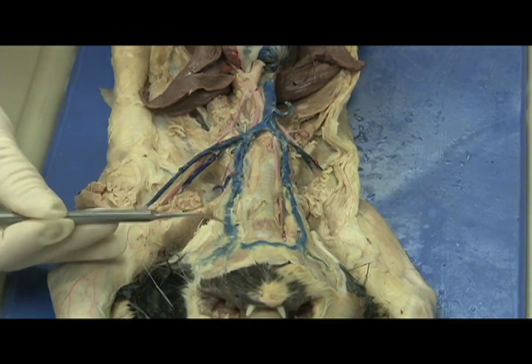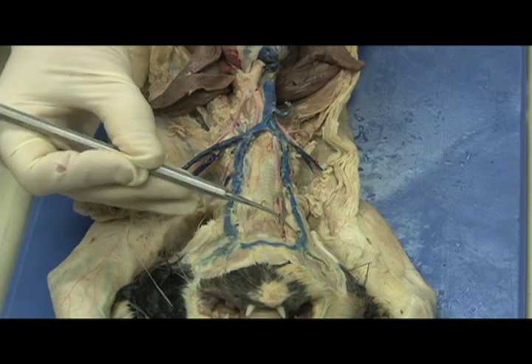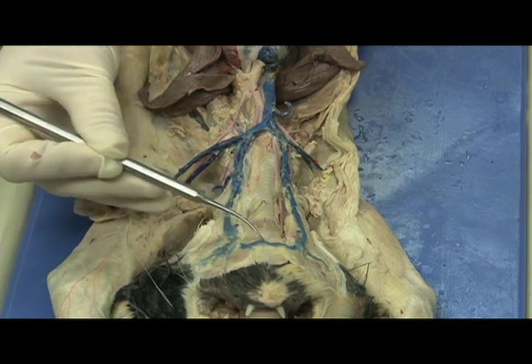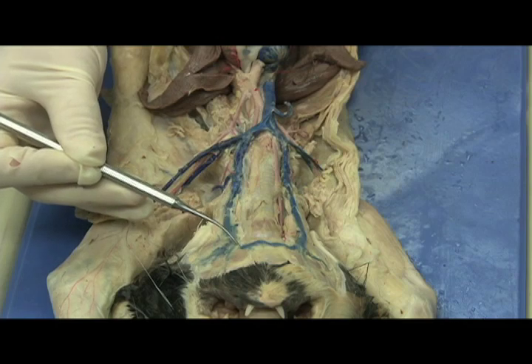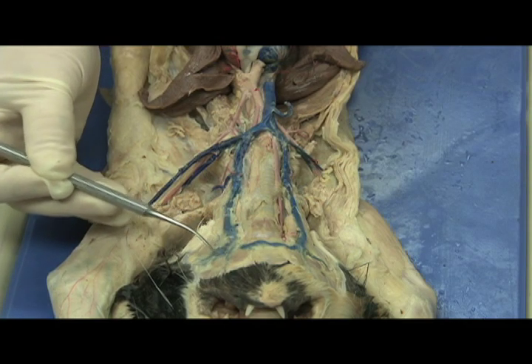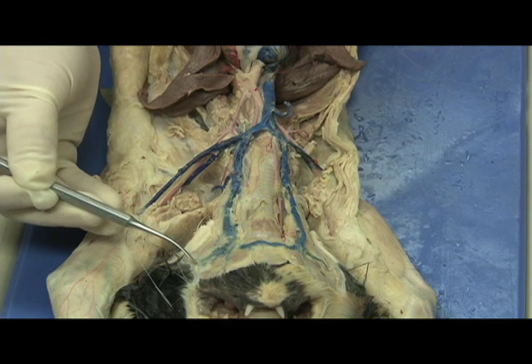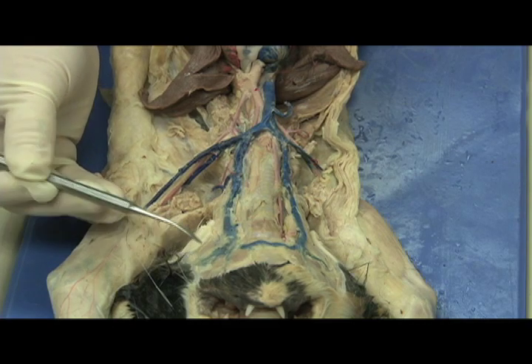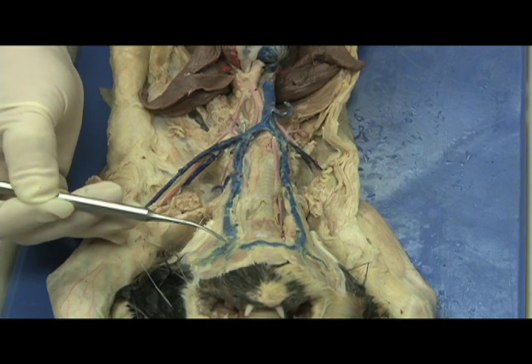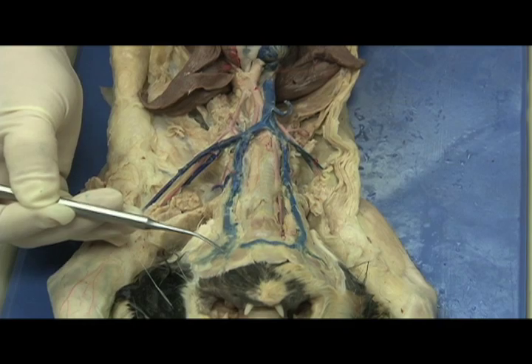Following the external jugular veins up toward the head, note a vein that connects both jugular veins on both sides, known as the transverse jugular vein. At this point the veins will bifurcate. One vein will travel behind the ear — this is the posterior facial vein — and one will travel under the jaw, and this is known as the anterior facial vein.